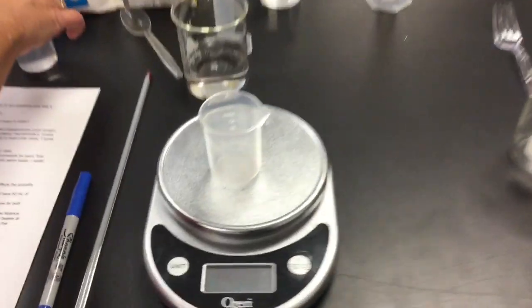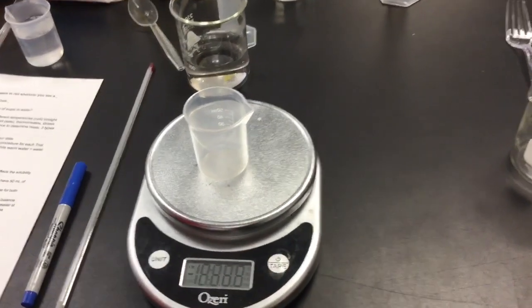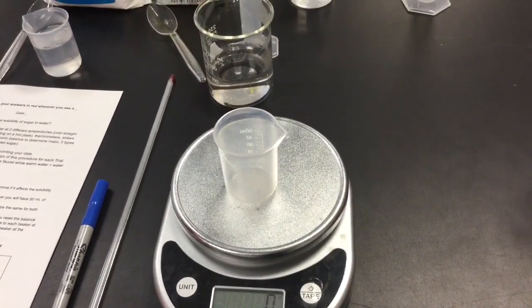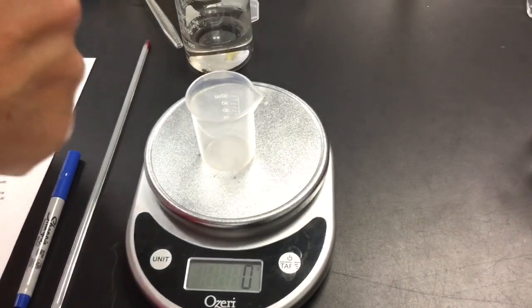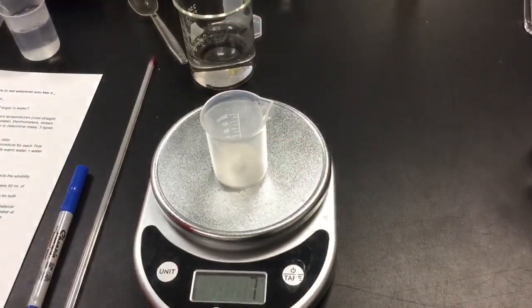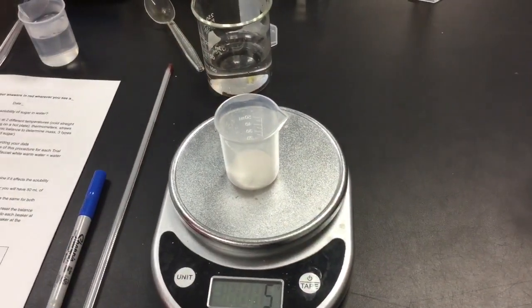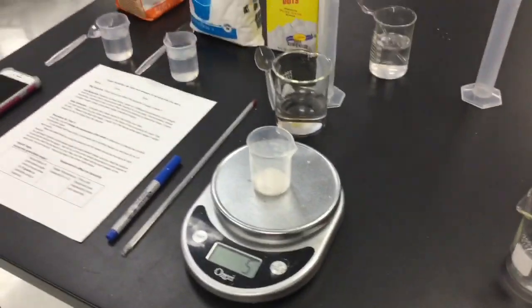containers. Well, first thing we want to do is we want to take our container. There you go. Put it on, and we have 0 grams. So it's on grams, and it's at 0. So now we're going to add as close to 5 grams as we can get of sugar. A little too much. There's 5 grams. Perfect. I'm going to need 1 more little small beaker, Mrs. Thomas. That's going to be it.